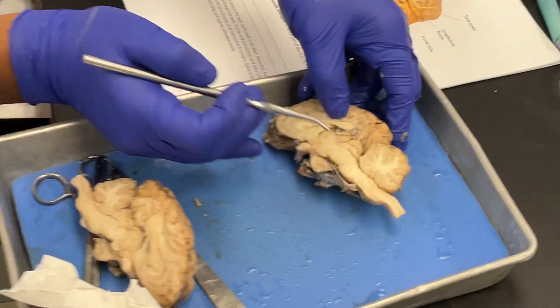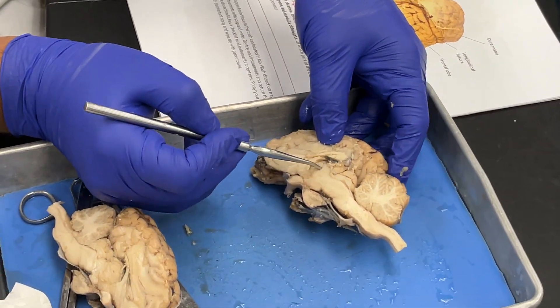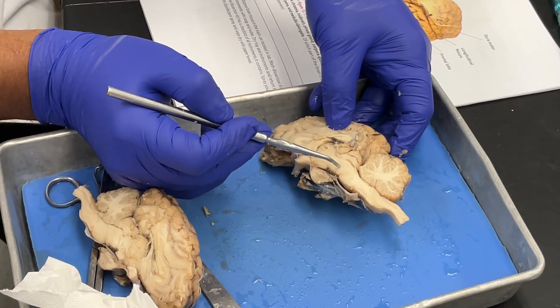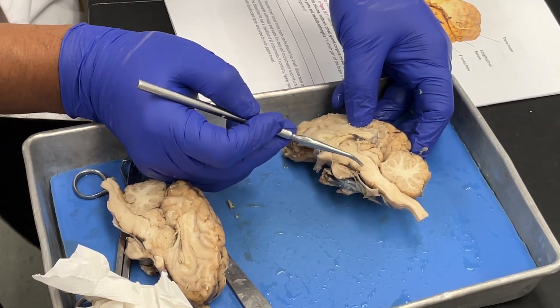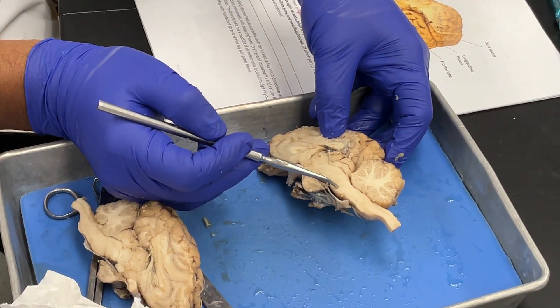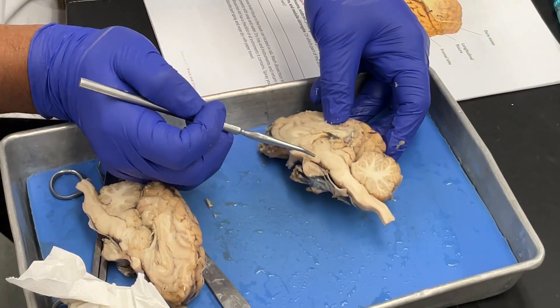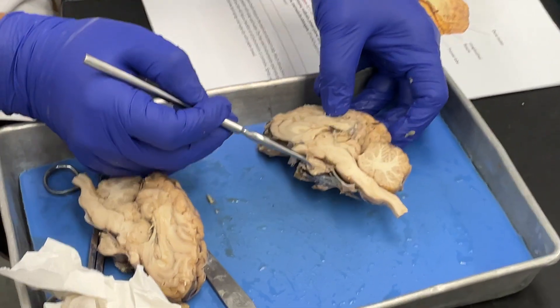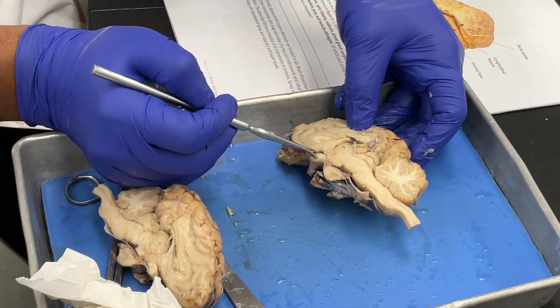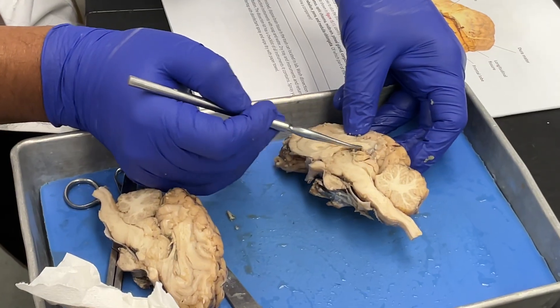Below the corpus callosum you see the thalamus. Below the thalamus is the midbrain, and then here is the medulla oblongata. Here you can also see the pituitary gland and the optic chiasma.